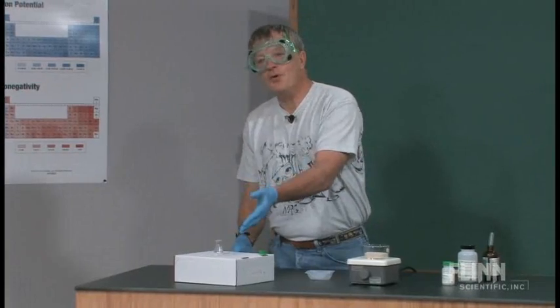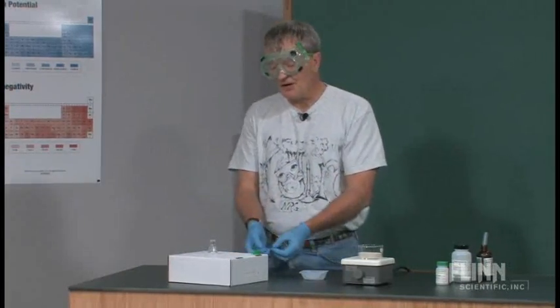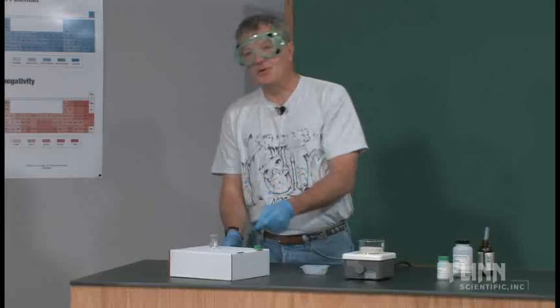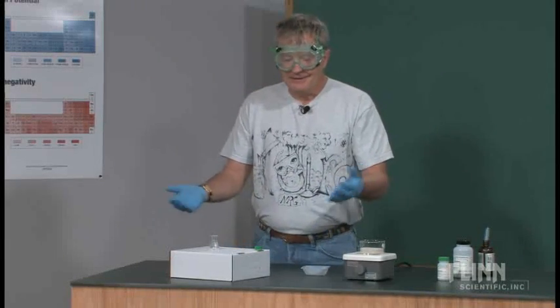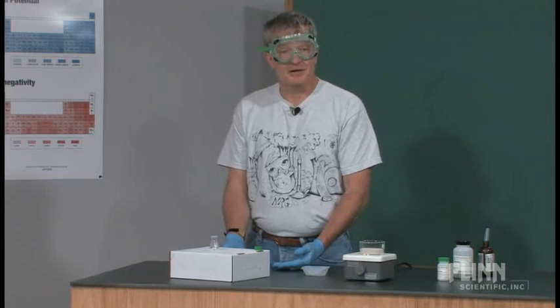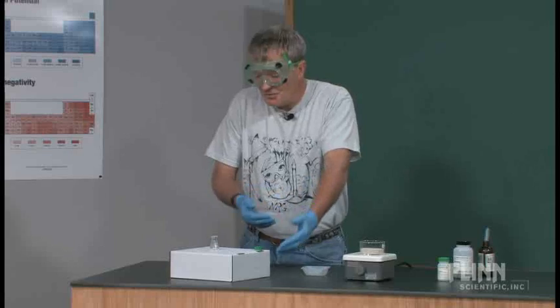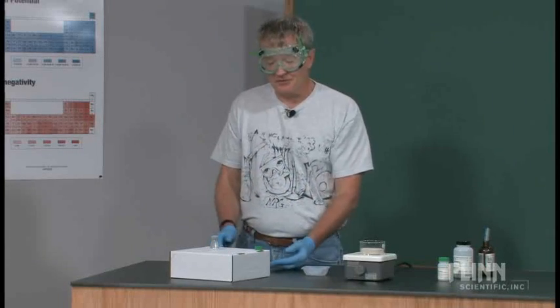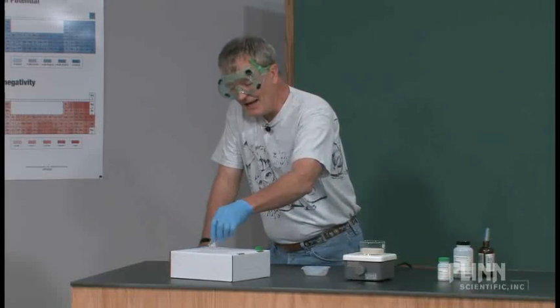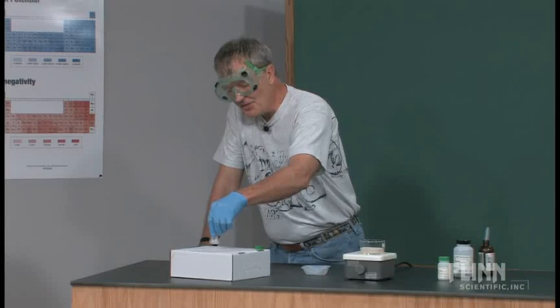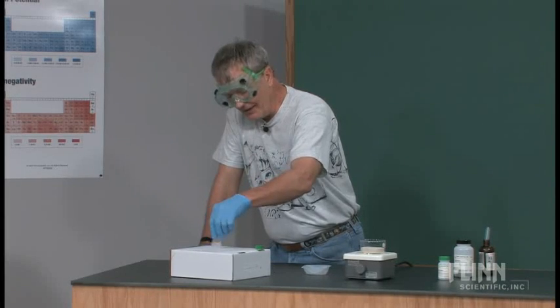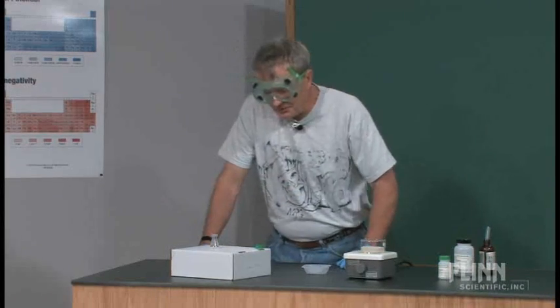This whole process, massing the stuff out, getting it into the flask, adding the hydrochloric acid, is going to take maybe 15 minutes. The kid's moving slowly, it's going to take maybe 15 minutes. Once they have that collected and the solid has completely reacted, now they need to evaporate it.